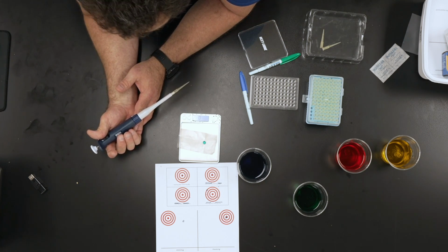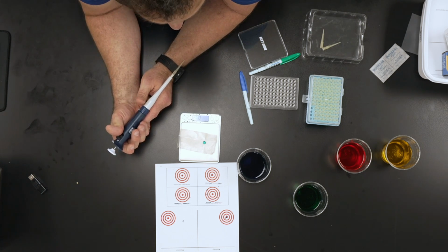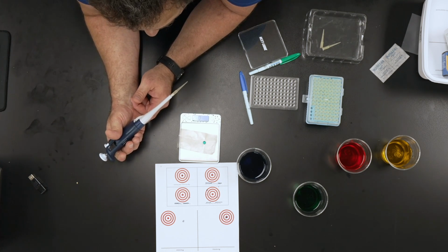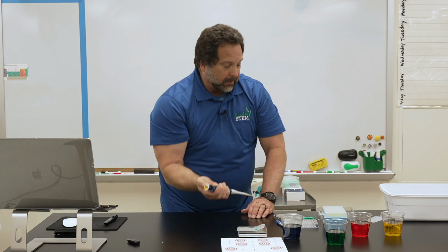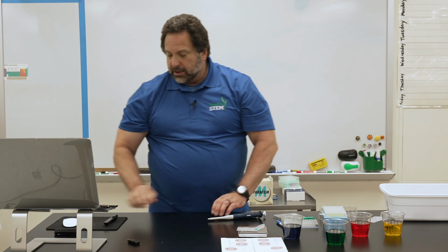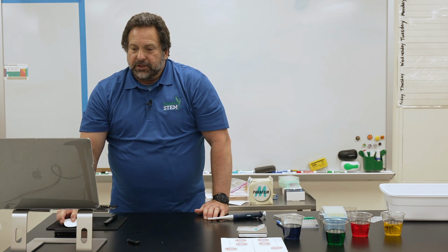Now, what you're going to try to do is, on one piece of this parafilm or wax paper, get that 2 mLs on there. So you've got to put drops that add up to 2 mLs. You've got to select which series of samples you're going to do: 10 samples of 200 microliters, 20 samples of 100, 16 of 125.